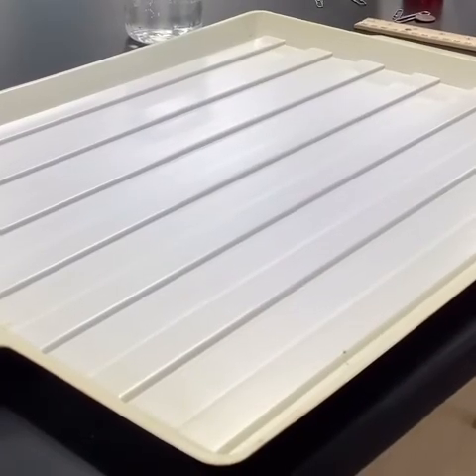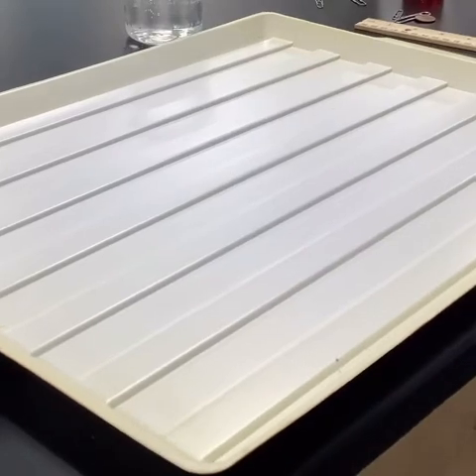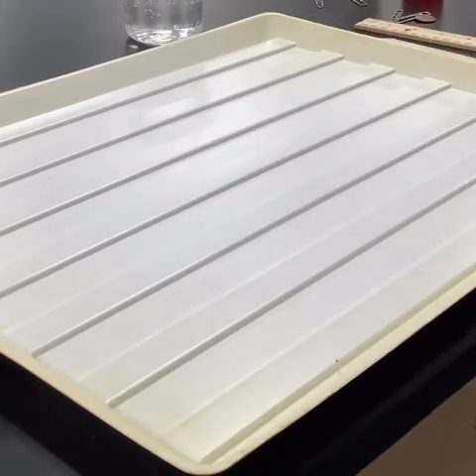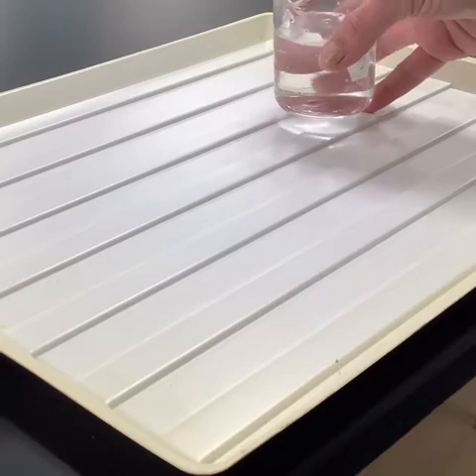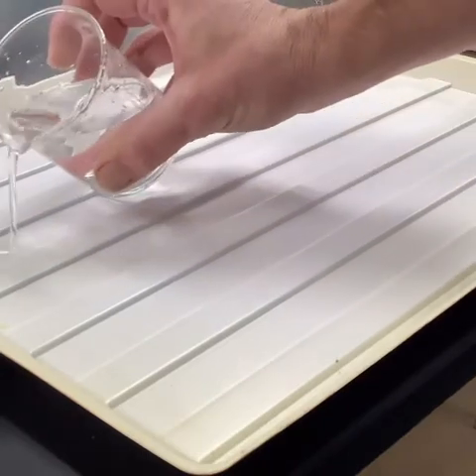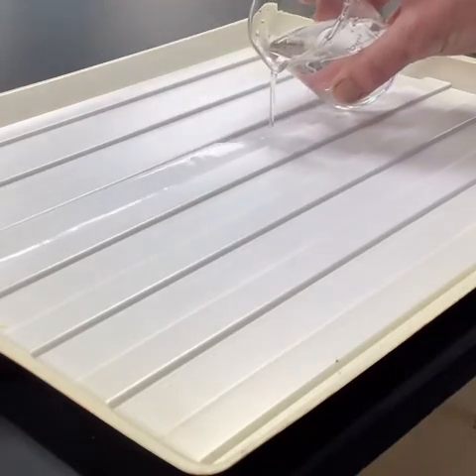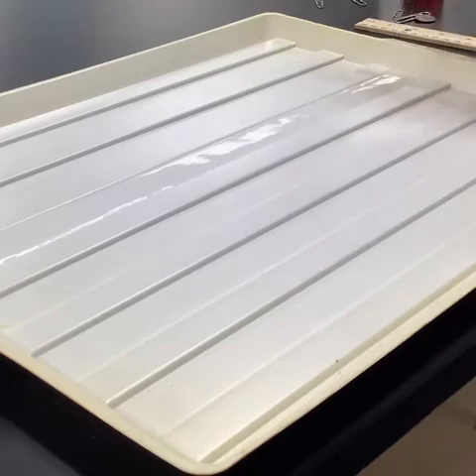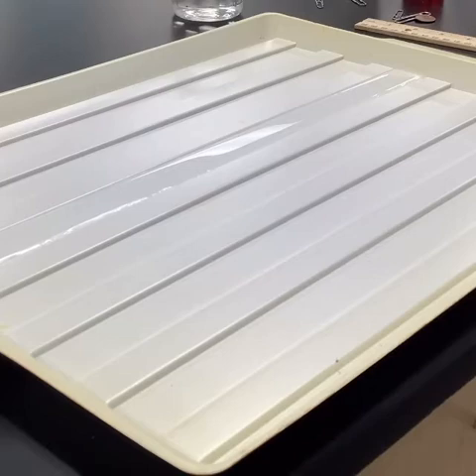And for our final piece, we're going to come over here to the plastic dish. We see in the plastic dish there's some grooves in it, and we're going to use one of those grooves. So I'm going to take some of the water and fill up one of those grooves, rather than fill up the entire tray. Okay, so we have the water filled in that center groove. We can see it coming along the line here.